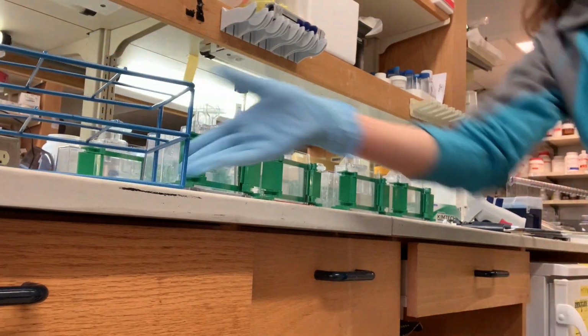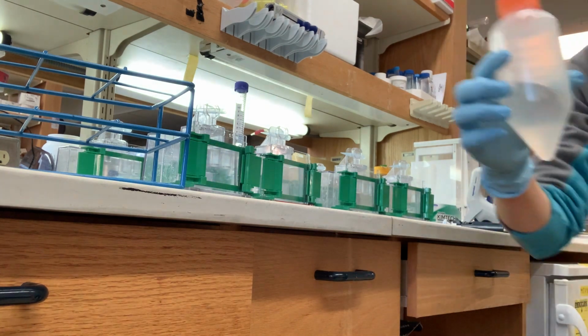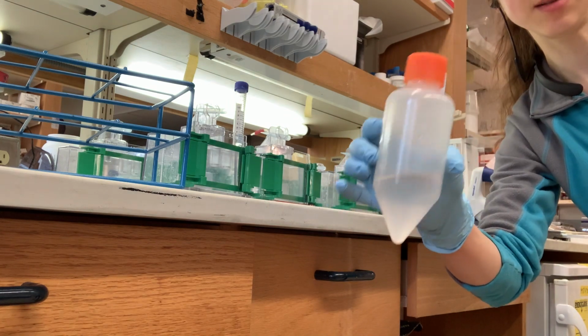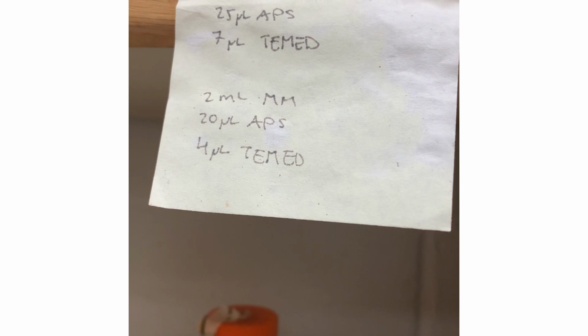Okay, I've got everything ready. I have everything I need right nearby, and it is go time. I normally do it in a 50 ml Falcon, but because I'm making a lot, I'm doing it in one of these tubes. This is for a 0.75 mm gel. Since I have a 1.5, I'll be doubling that per gel, and I always make enough for one extra in case one's leaking. I can fix it and then fill it up.